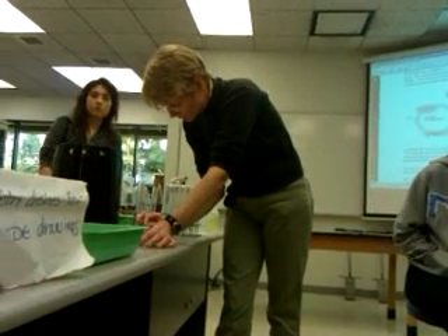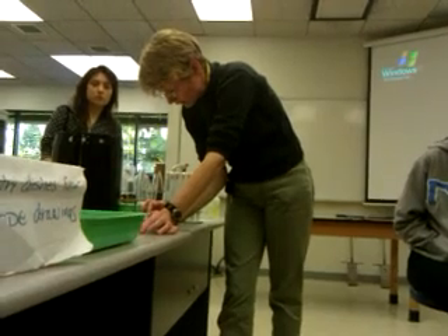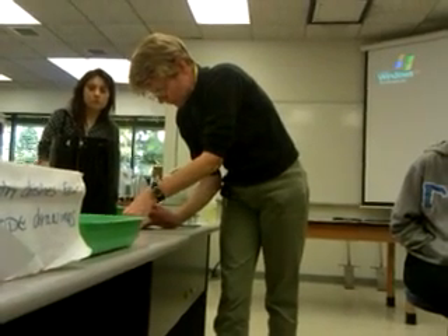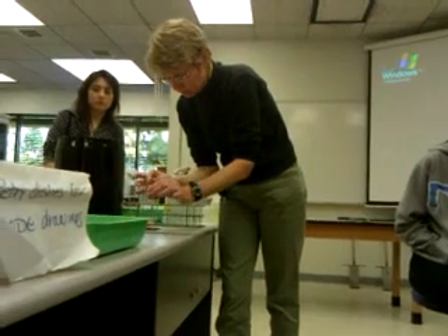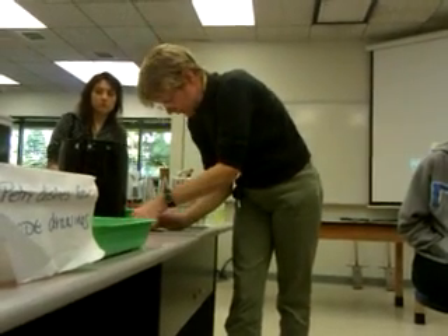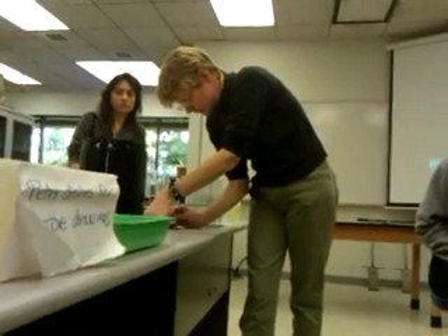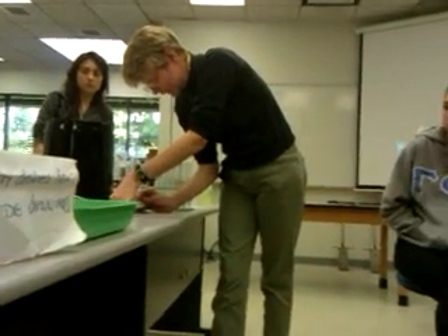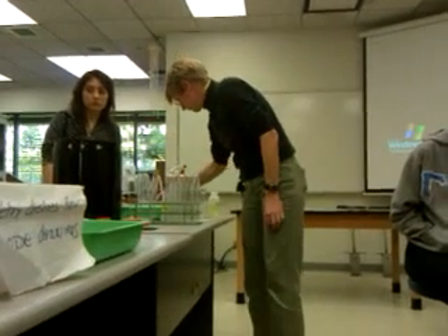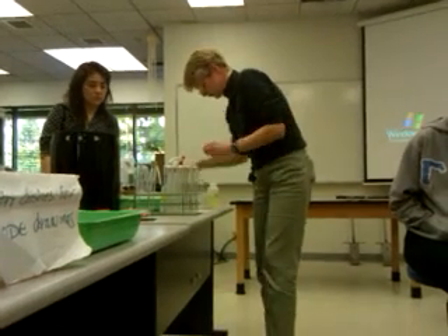On Tuesday and Monday, everyone got to do this for their table. By last night there was not enough of the brown algae extract anymore, so let me put a little bit more on. There's a very limited amount of brown — I hope next semester they have enough, especially if they do four labs. This one here has been used. Keep it closed — that's also a very good idea.